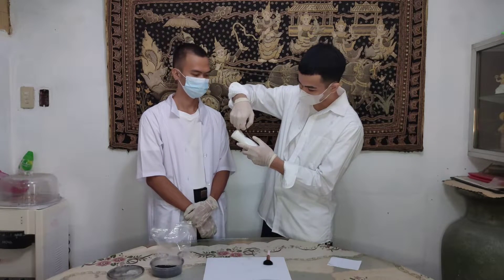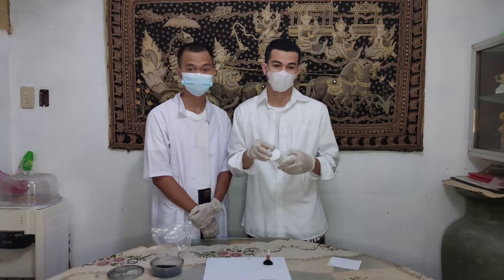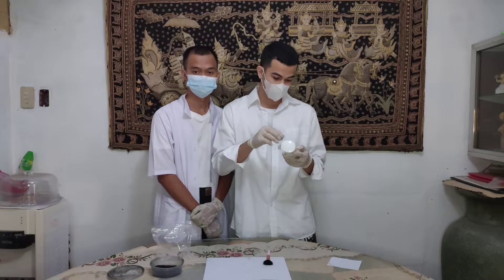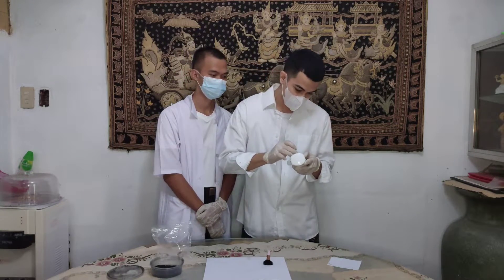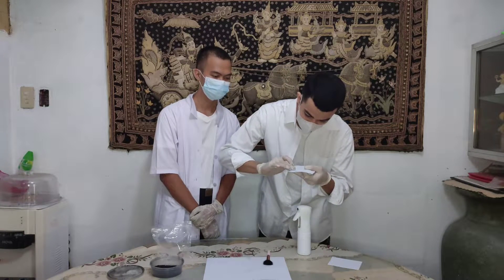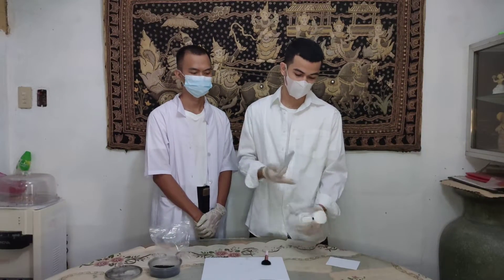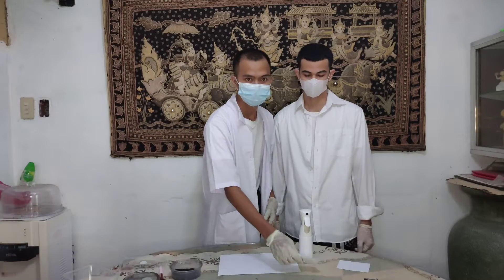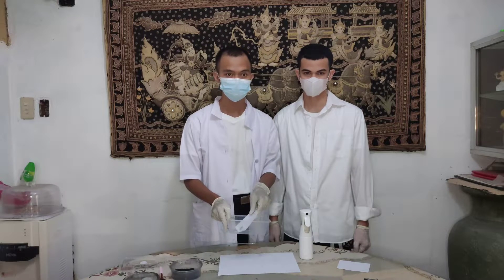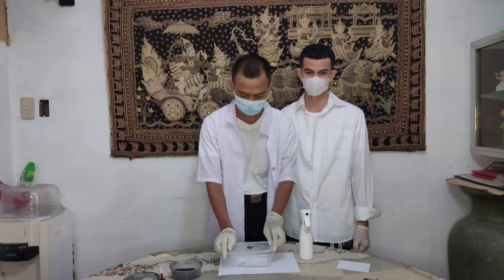Cover the fingerprint mark with the tape. After this, place the fingerprint impression onto the fingerprint card. This is what we obtain from the item from the crime scene. Store this evidence in a clean and dry container in order to prevent contamination and alteration of the obtained evidence.